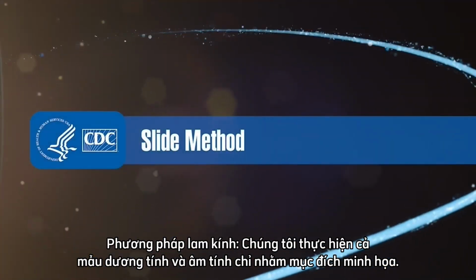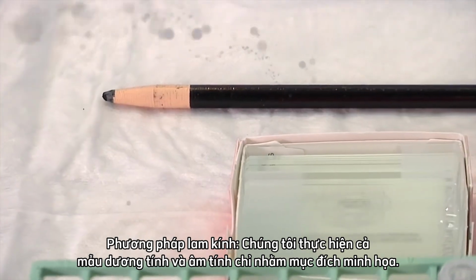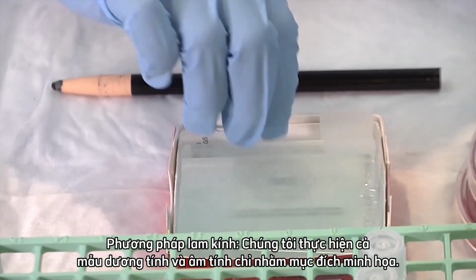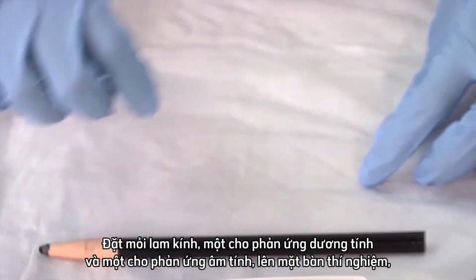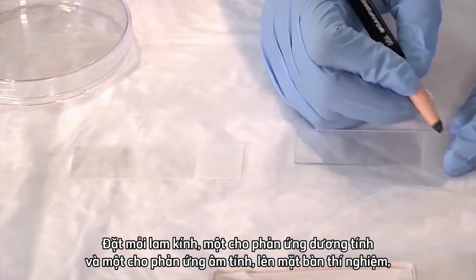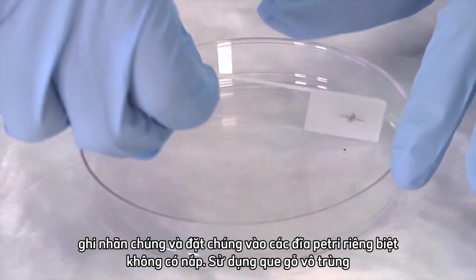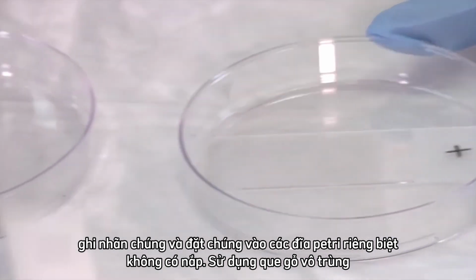The slide method. We are doing both a positive and negative test for demonstration purposes only. Place each slide, one for the positive reaction and one for the negative reaction, onto the bench top. Label them and place them in separate, uncovered petri dishes.